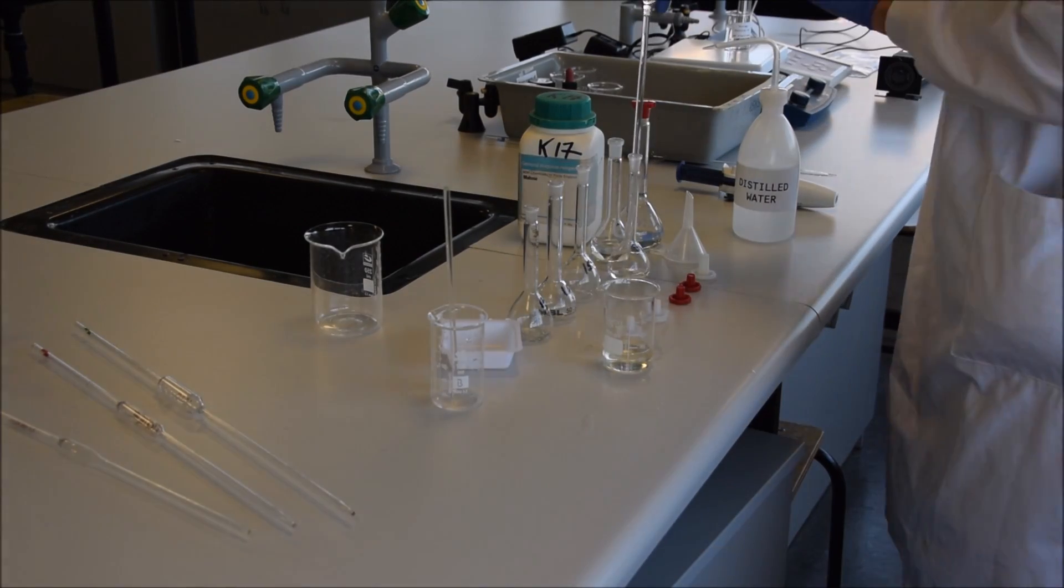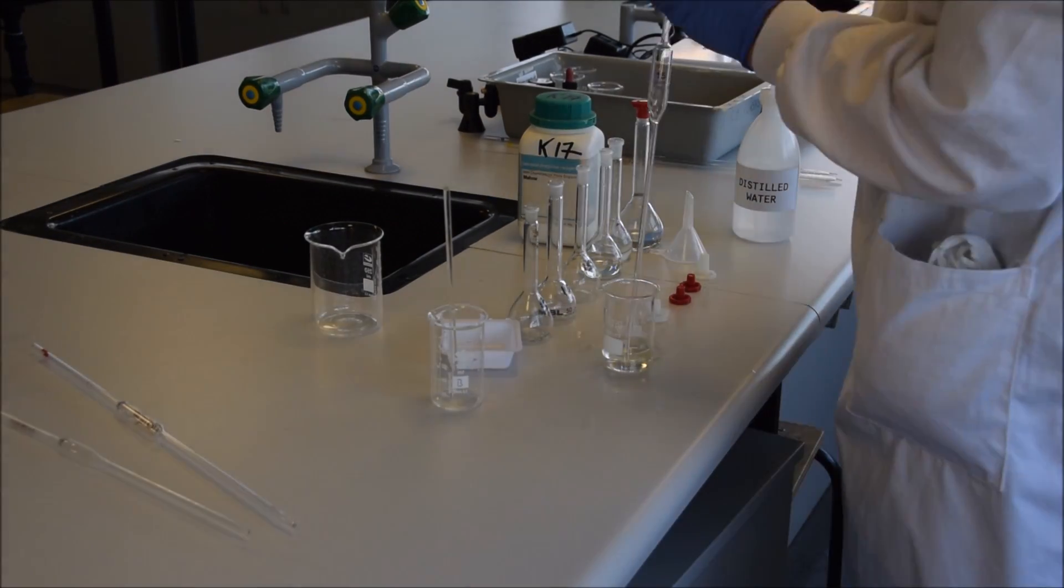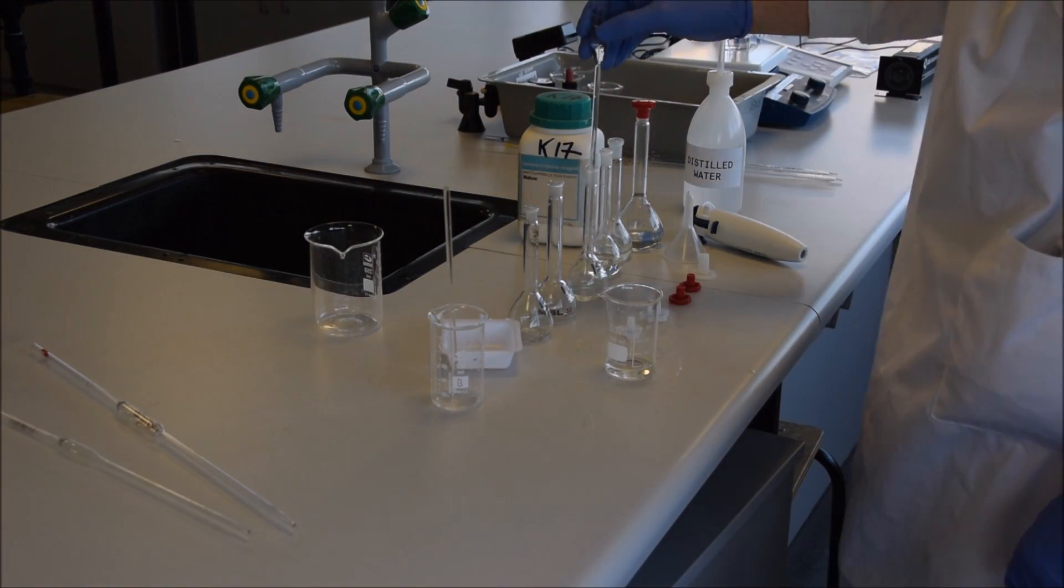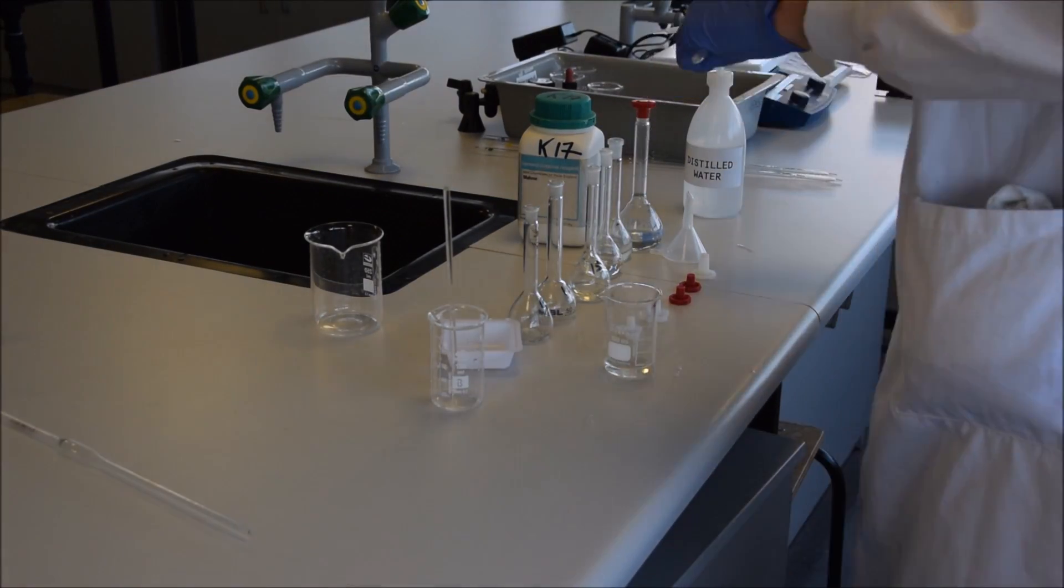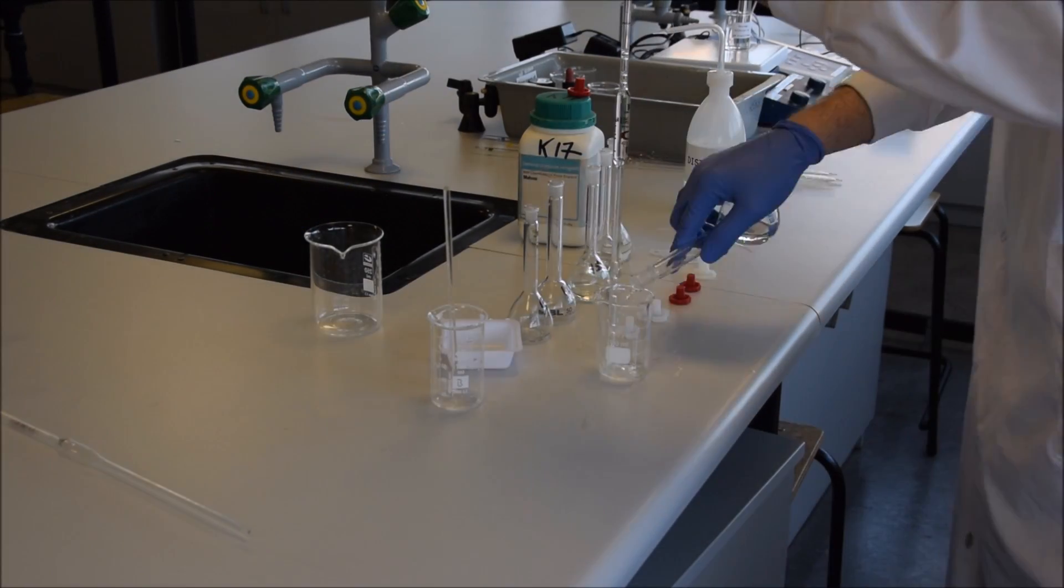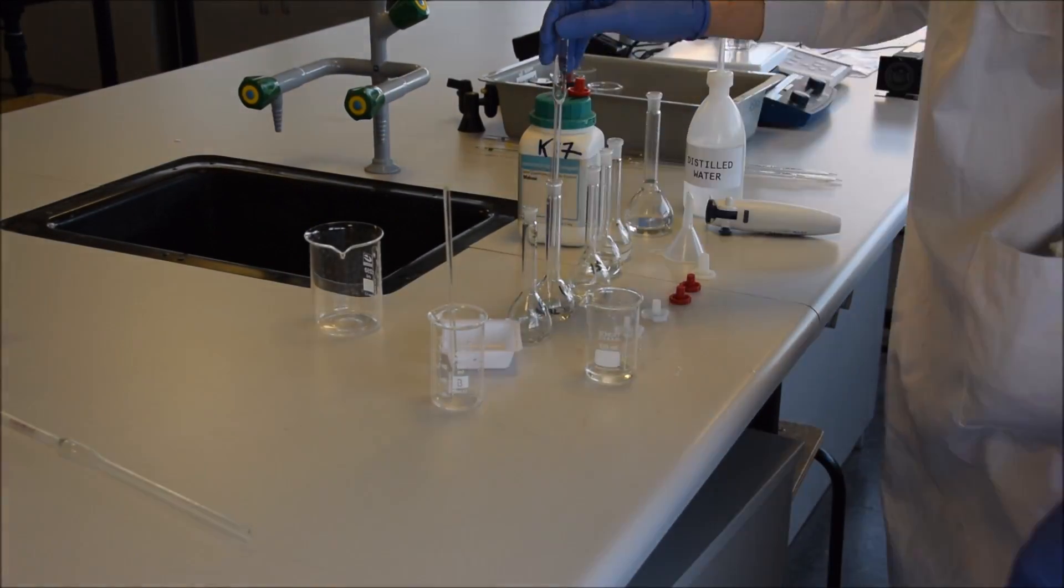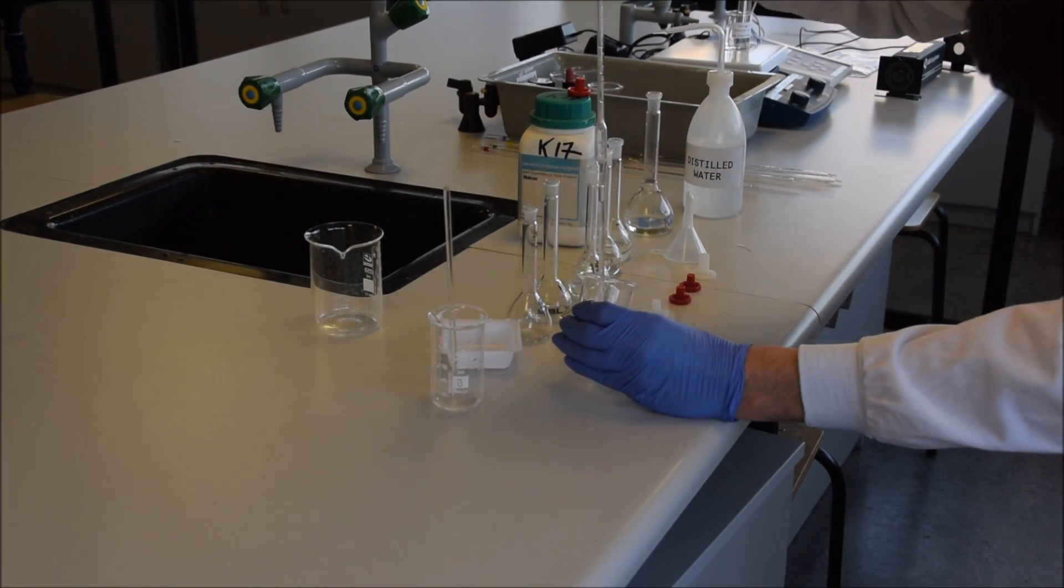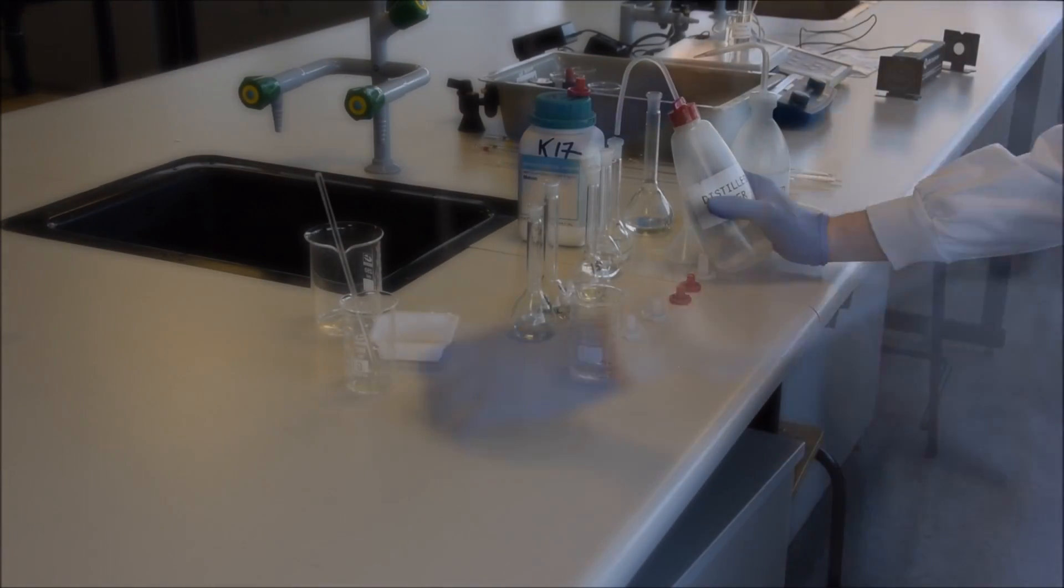I'm washing each pipette as I use it. Notice that I'm safely inserting the pipette while holding it near to the pipette filler, and when I want to let the solution back out again, I can take the pipette filler off the top and allow it to drain. Each pipette is rinsed out with the sugar solution before you pipette into your volumetric flask.